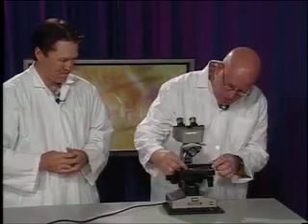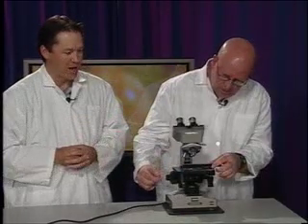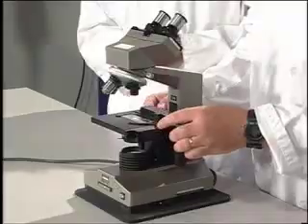I don't know if I've ever seen a crustacean. So I pull this thing and then slide it in. You slide it in 90 degrees to the slide, and there's a little slot to put it in, in the opposite corner. Then you want to gently release that back to the slide. You don't want to let it go, because it may shatter the glass.